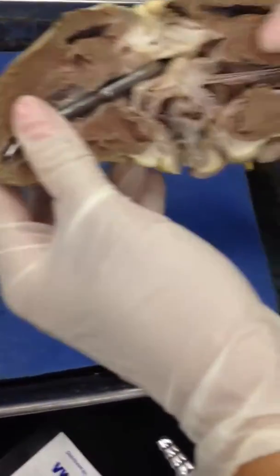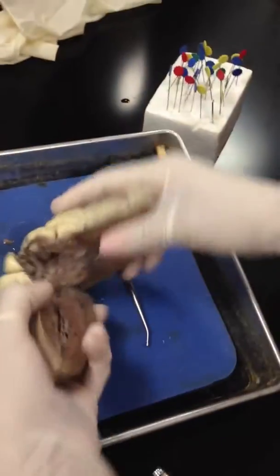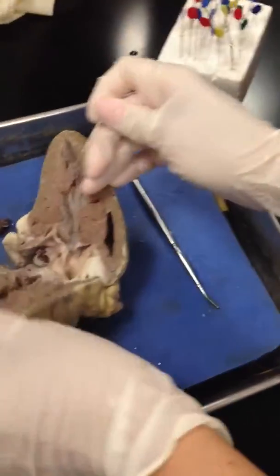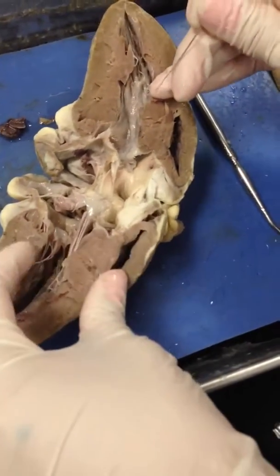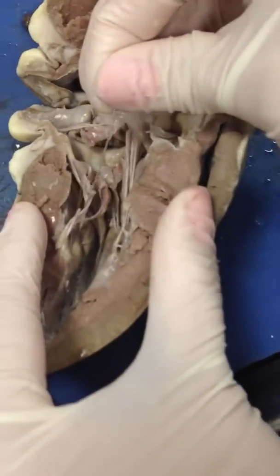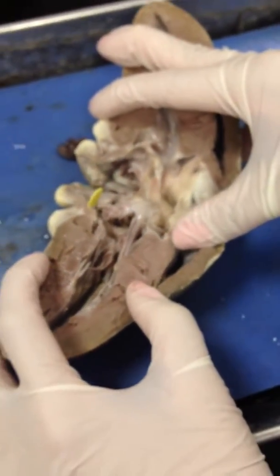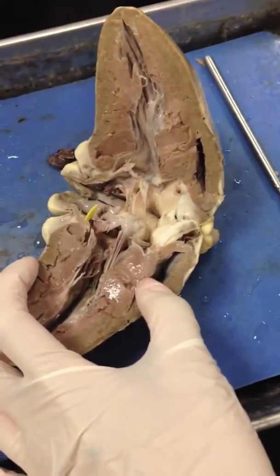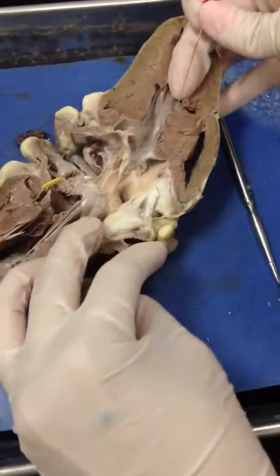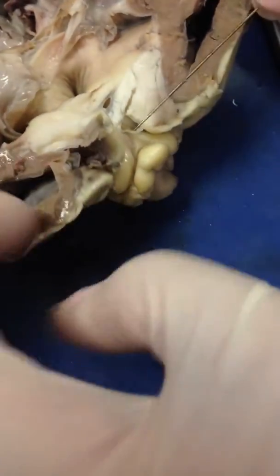For the semilunar valves, that's how I would ask it. But for the other valves — the tricuspid and bicuspid valves — you can really see them anyway. Right here, here's the bicuspid valve attached to the chordae tendineae, attached to the papillary muscles. So I could just put a pin right there, and we know that it's on the left side of the heart, so what valve is that? Bicuspid valve. Good.